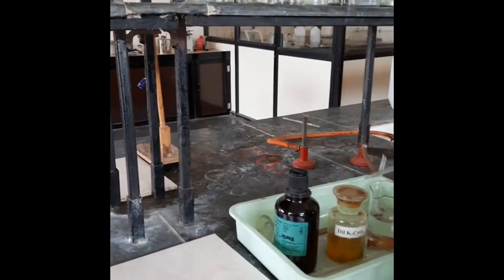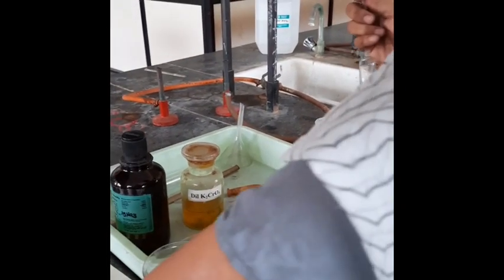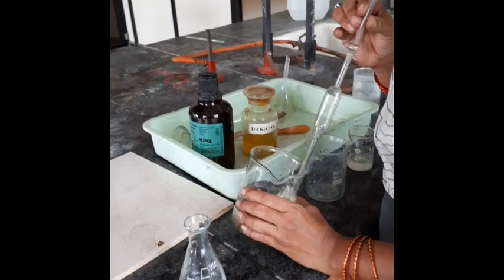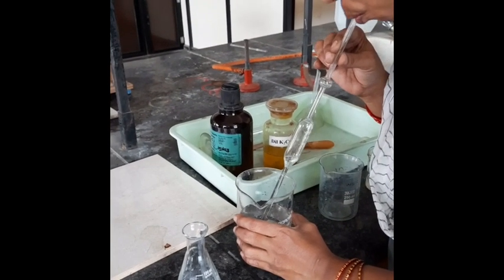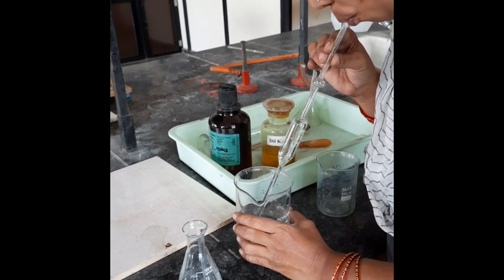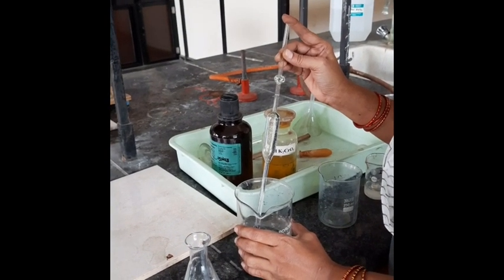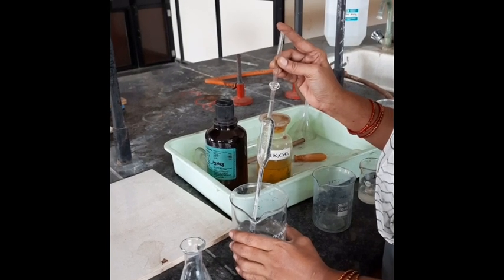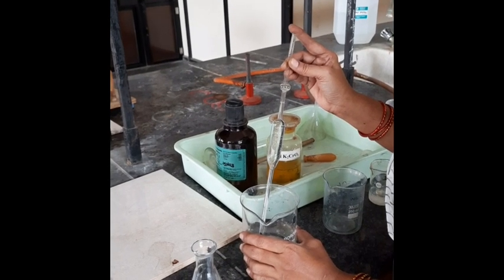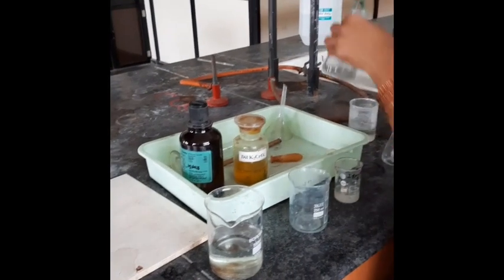Then you have to take 25 ml water sample. This is the water sample. This is the 25 ml pipette — you have to pipette out 25 ml of water solution, which we have taken. That is the tap water. You have to adjust the water to that marking — it is 25 ml. Transfer it to the conical flask.